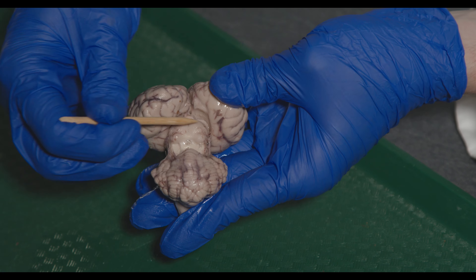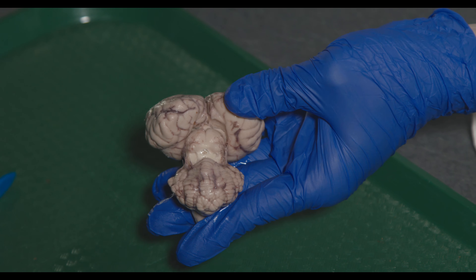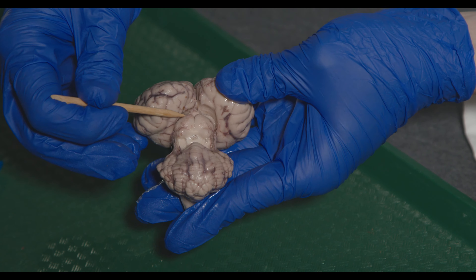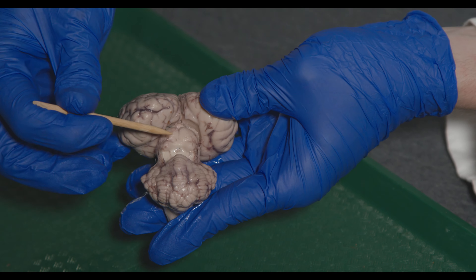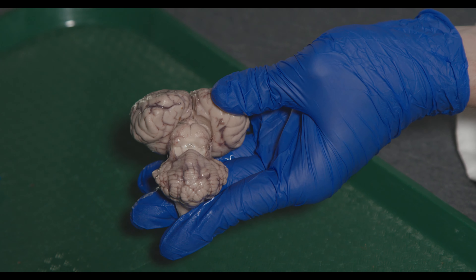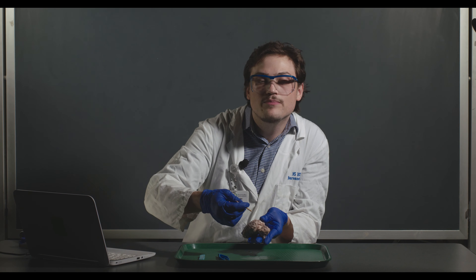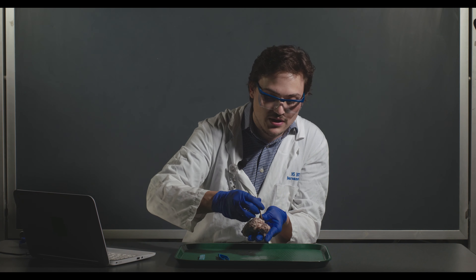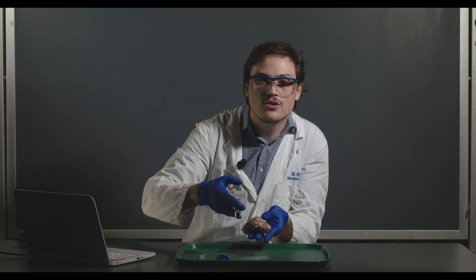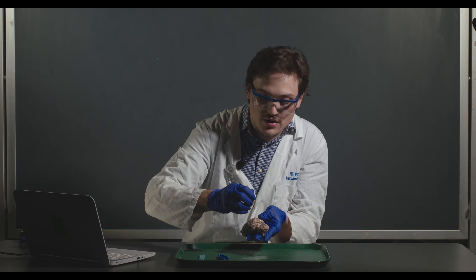Here you can see the fourth ventricle underneath the cerebellum, and the tectum. The superior colliculi are a stop for visual information — involved in eye gaze and some visual processing. Just inferior to them are the inferior colliculi, which are one of the main stops in the ascending auditory pathway. Collectively they're referred to as the tectum, or sometimes the corpora quadrigemina, which just refers to all four colliculi together.